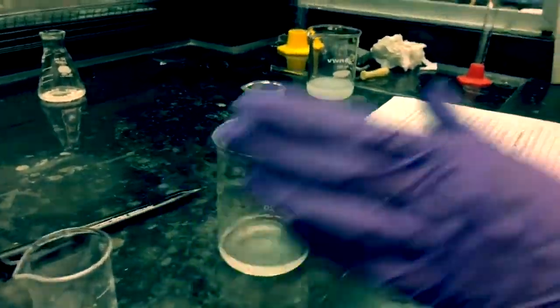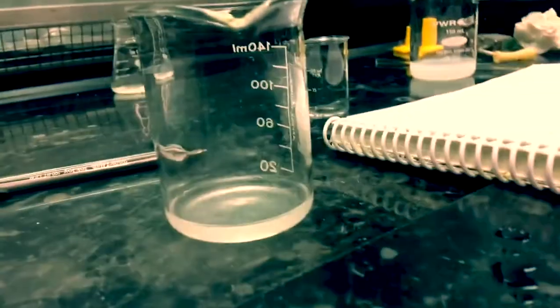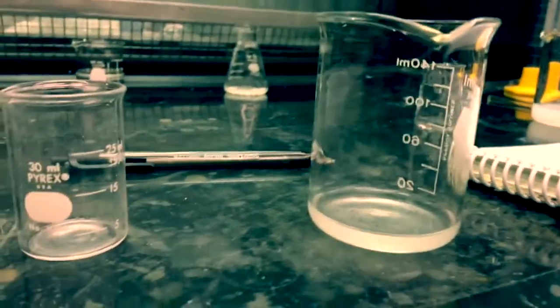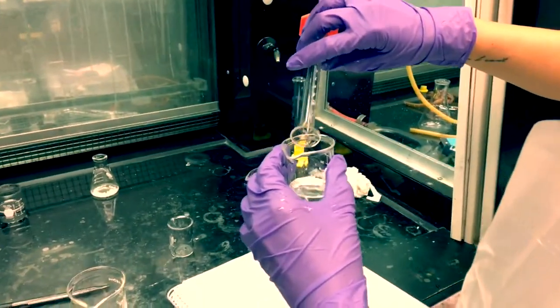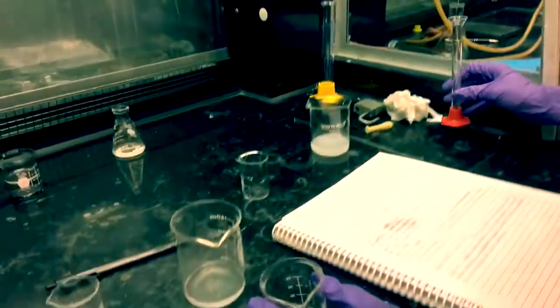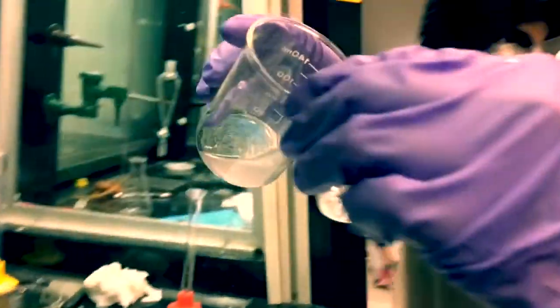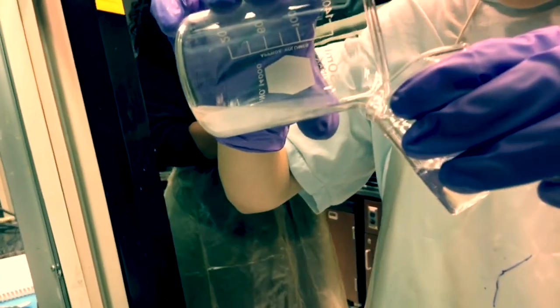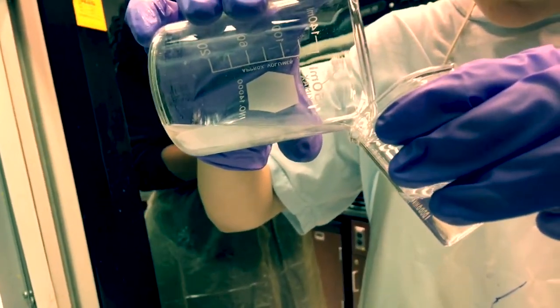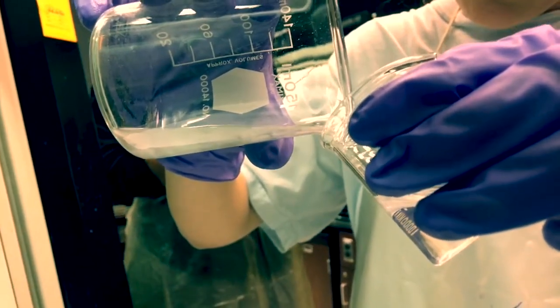Then, we are going to prepare Nylon-6-6. In order to do so, place 10 mL of 5% hexamethylenediamine into a 50 mL beaker. Then, add 10 drops of 20% sodium hydroxide. While slightly tipping the beaker, carefully add 10 mL of 5% adipoyl chloride in cyclohexane by pouring it down the wall of the beaker, being sure to form two layers. There will be an immediate formation of nylon at the interface of the two layers.